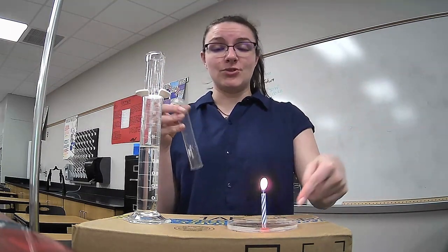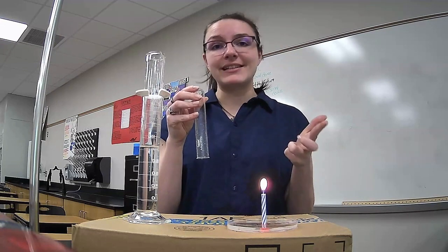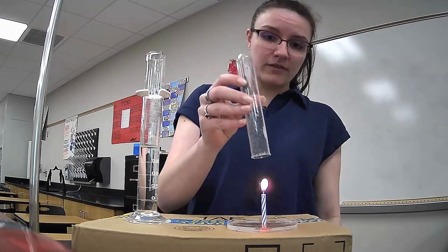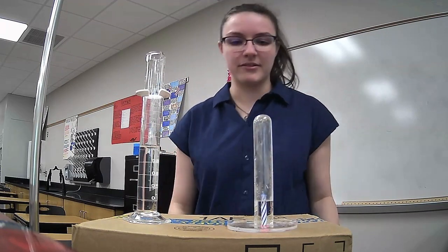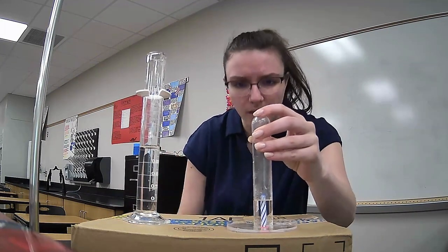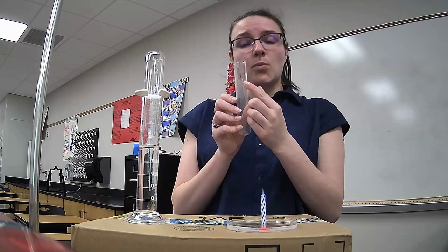The water in my Petri dish doesn't like that there's a vacuum in here now that the oxygen is gone, so the water is going to rise up to fill in the space left behind by the oxygen. And I want to measure how high that water rose. So when I put the test tube over the candle, it goes out and the water level rises. And I'm going to use a highlighter or an Expo marker to mark how high that water rose to. And now I've got a mark that shows where the water reached.